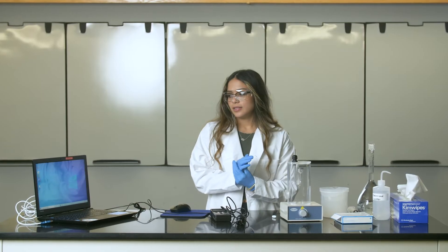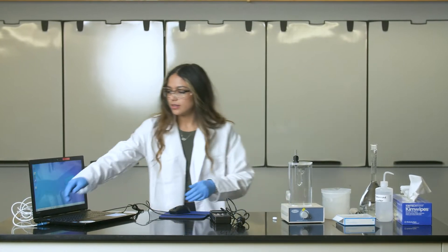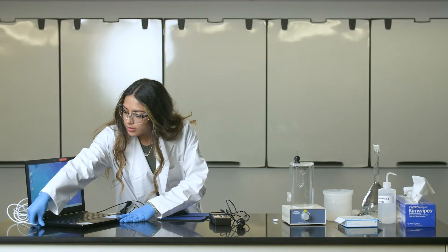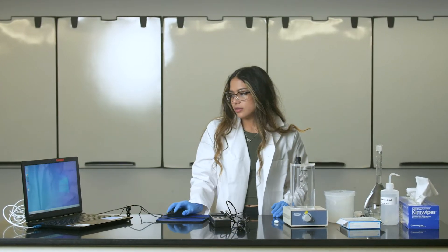So now we are going to show you how to actually do the experiment. Firstly, we have to connect the conductivity meter to the computer and then you can start the program.